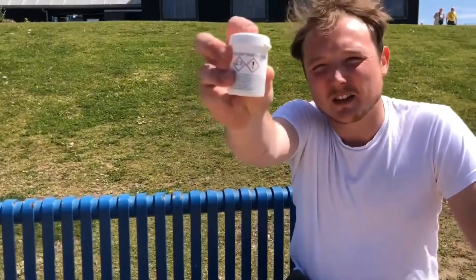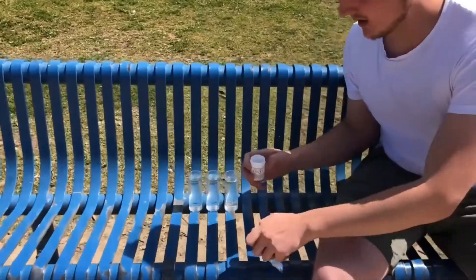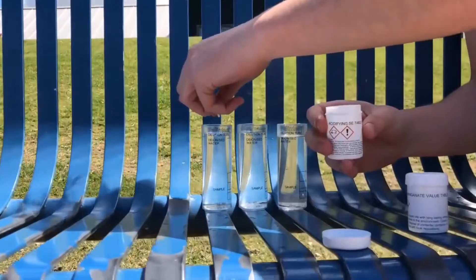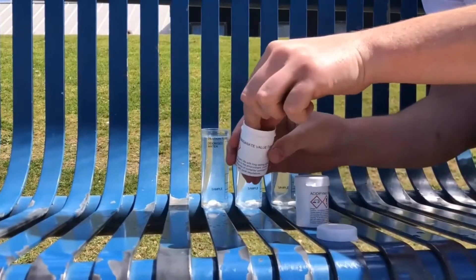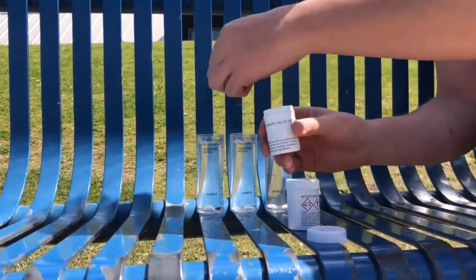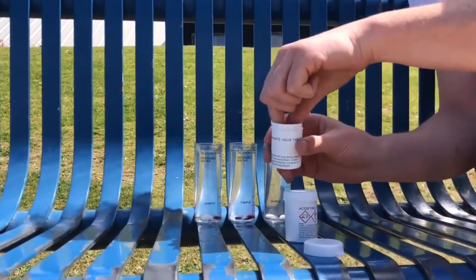What we're going to need are your acidifying tablets and your permanganate tablets. Put two of the acidifying tablets in each container, then add the permanganate tablet. How this works is you put one in the first, two in the second, and three in the third.